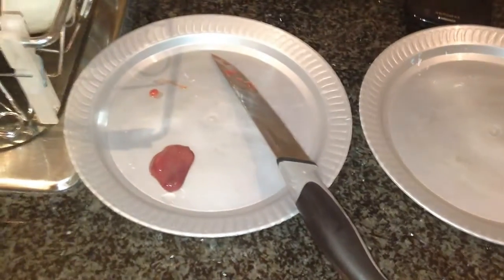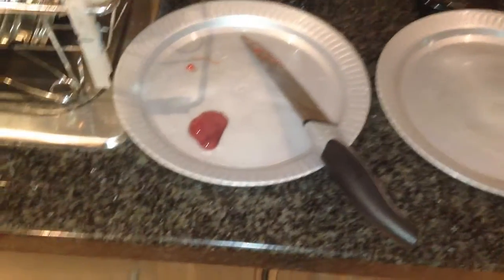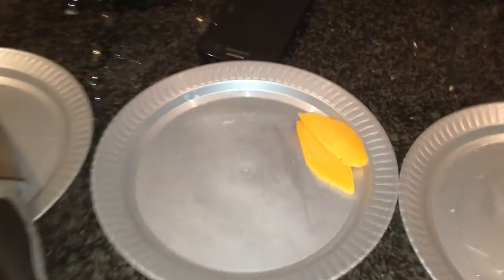Okay, got the foodstuffs out of the packaging now. Guys, safety first. This hydrogen peroxide can burn. I haven't burnt myself yet, but I'm wearing gloves. Okay, cheddar cheese. Just need a small amount. You don't need a lot.